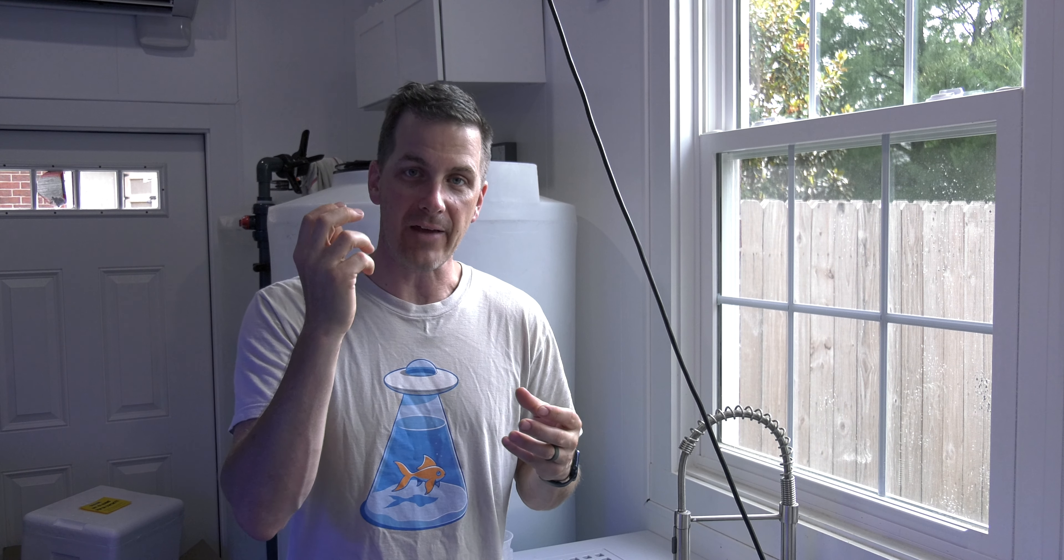So here's what I do to really make sure that I've locked in that color change. I start adding in the solution until I start to see a color change in the vial. Then I make a note of how much solution I've added.